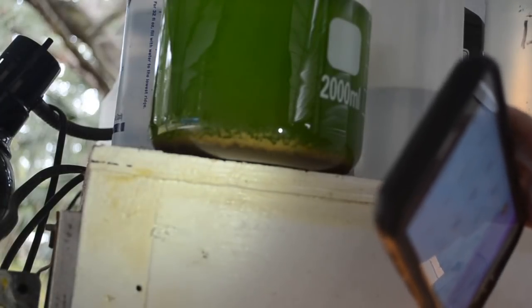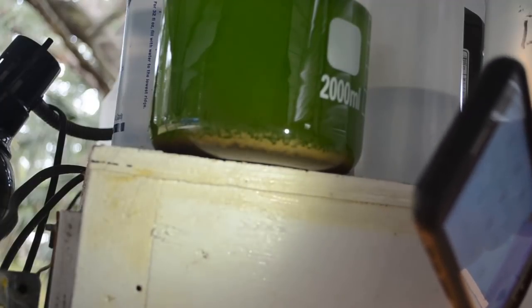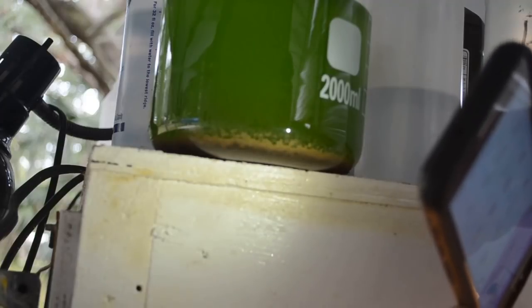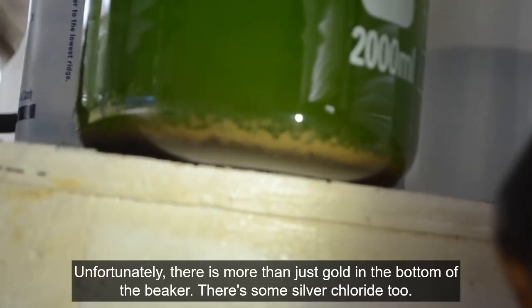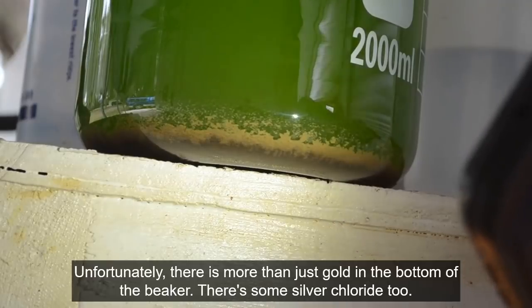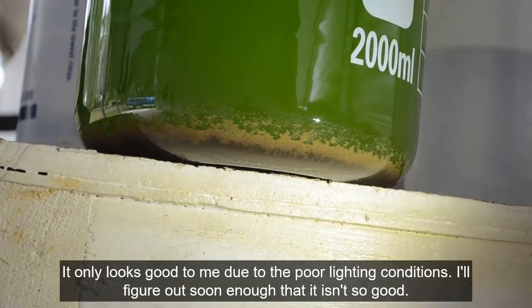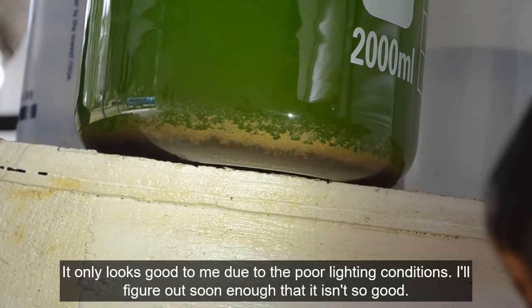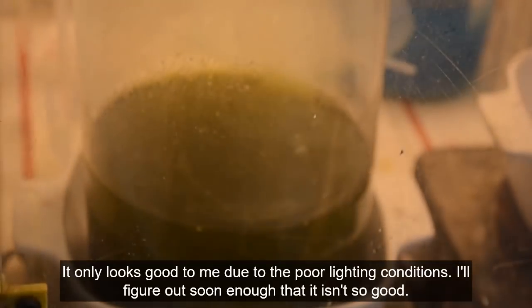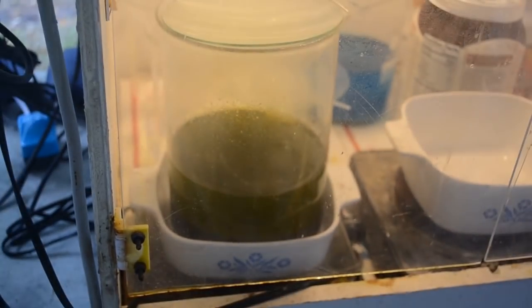Yeah, it's a dark and gloomy day today. It's going to rain. So I got my phone out here lighting up the bottom of this beaker. There's that layer of gold that's formed in the bottom of it. It's surprisingly good looking gold. Out of such a green solution, I wasn't expecting to get such good looking gold, but there it is. It looks like there's a fair amount there too. So that's nice. Hopefully we'll get some more out of this stuff too.